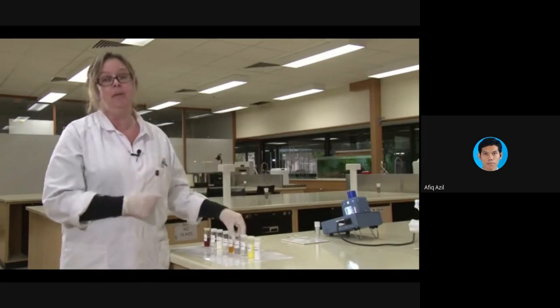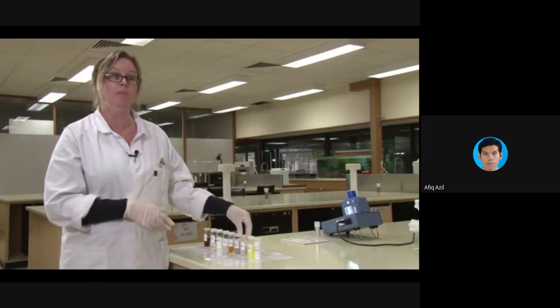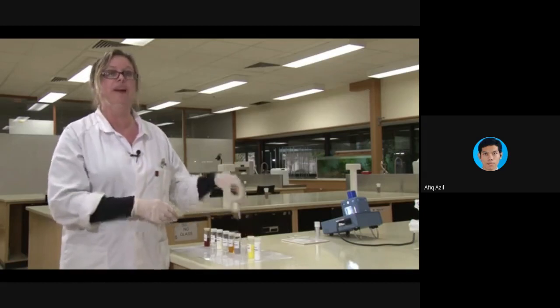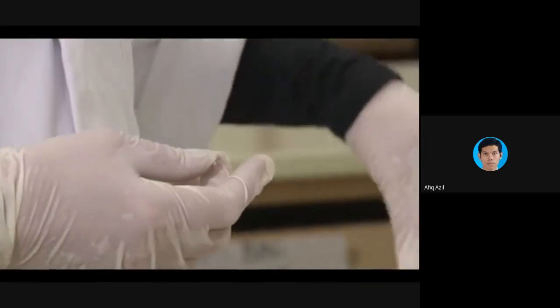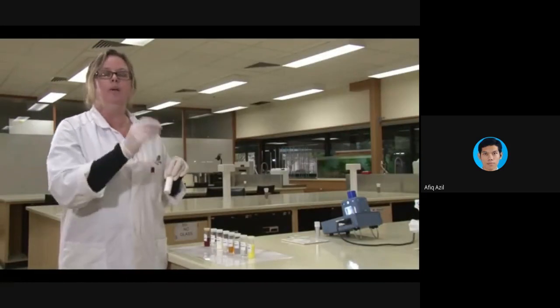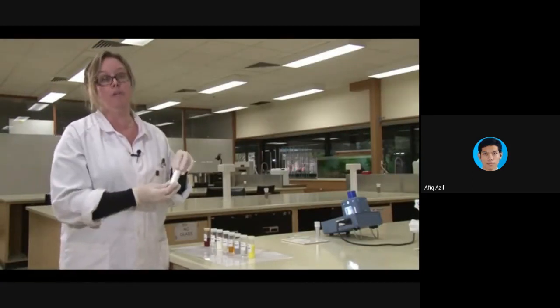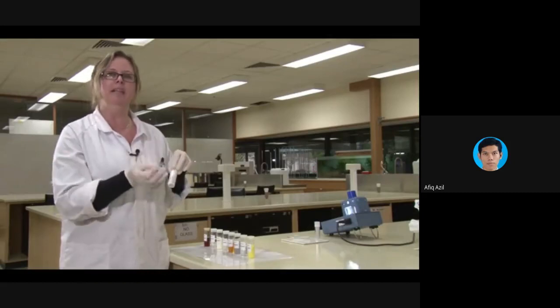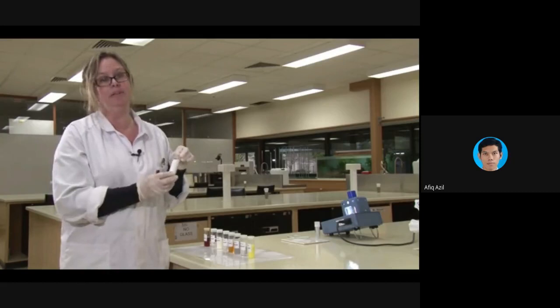The first step in this test is to determine the melting point or the boiling point of the compound. If you have a liquid, carry out a boiling point analysis. But if you have a solid, do a melting point analysis. The melting point will always be a range, and the size of that range will tell you how pure your compound is. So it should be within 2 or 3 degrees from when it starts melting to when it finishes melting to tell us that we have a really pure compound.